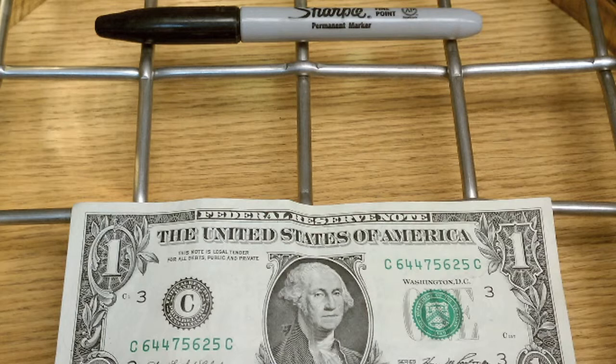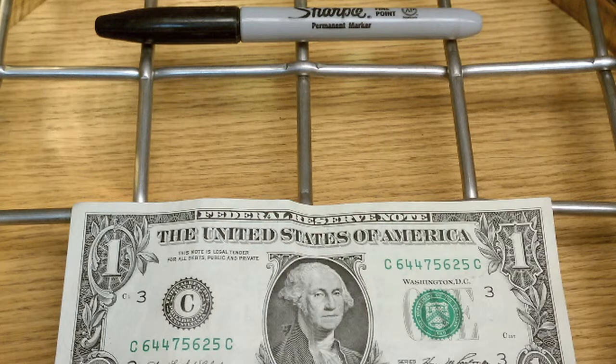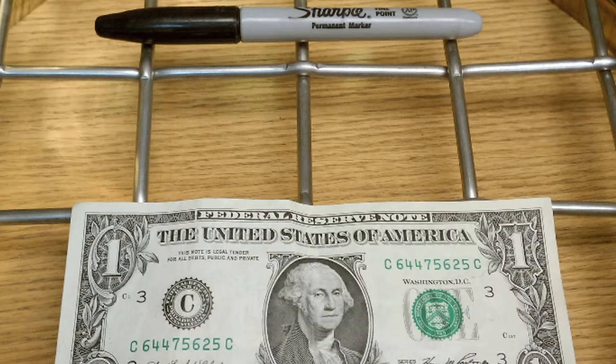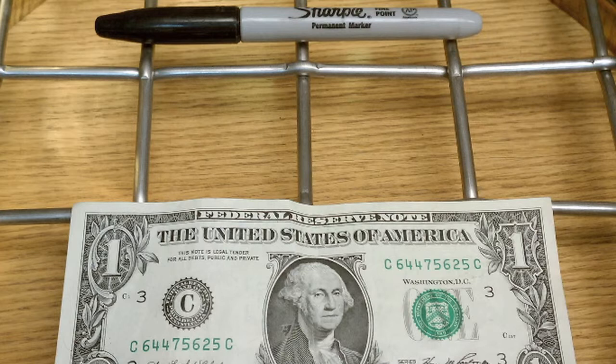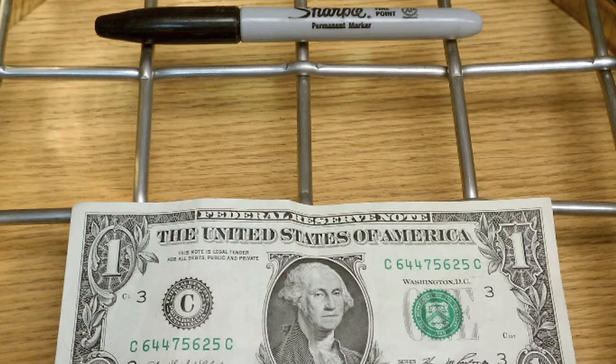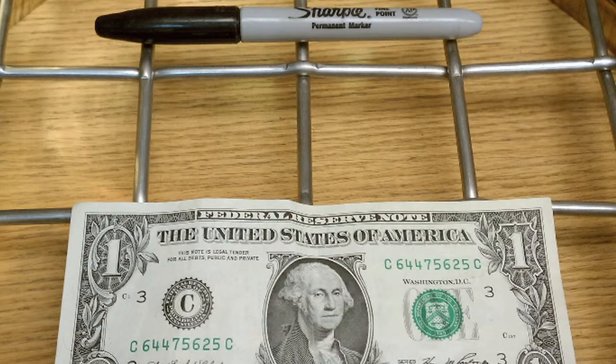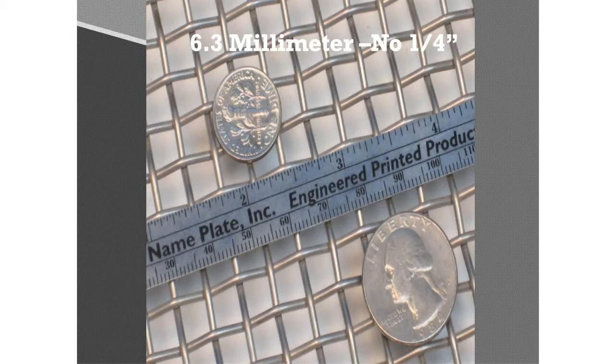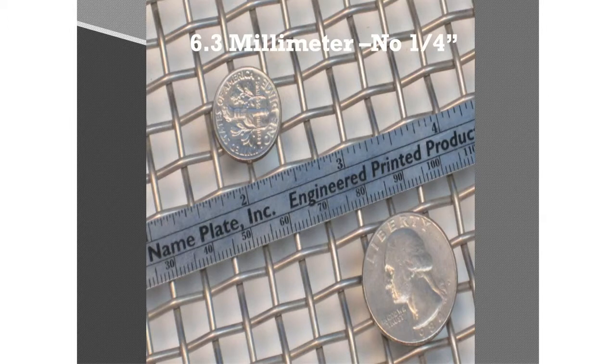Our objective is to give a frame of reference by relating the opening sizes to real life material. We start with a 50 millimeter or 2-inch sieve, using a dollar bill and a pen for reference. We then make a jump to 6.3 millimeters or a quarter inch.